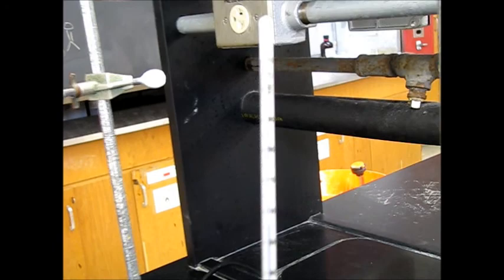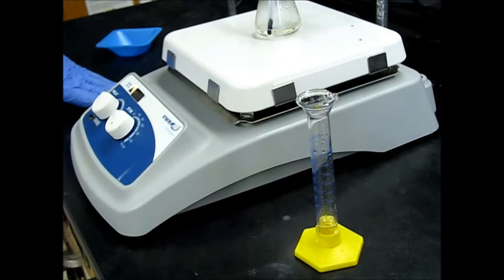And then, so 10 minutes in, according to the procedure, 10 minutes in, we need to add two milliliters of water. So that'll be here in about four or five minutes. So we'll go ahead and add this water here in just a minute.